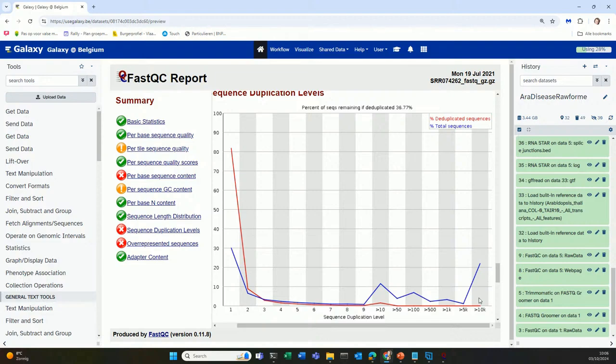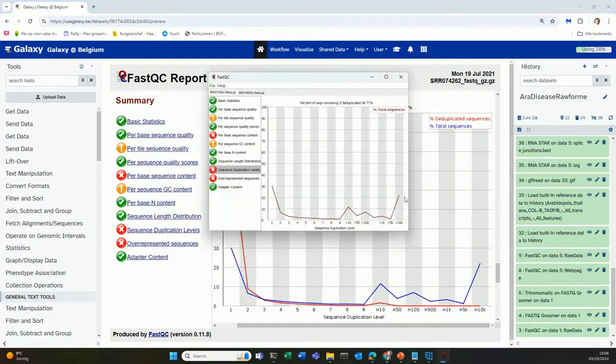And when they are there, they typically pop up here at the utmost right of the plot, because it will be one sequence, the adapter sequence, one sequence that occurs a lot in your FASTQ file. And that's what you see here, or here. So a sequence that occurs very, very often. Your housekeeping genes and your ribosomal RNAs will typically end up here in this region. So these peaks that you see here are probably coming from housekeeping genes. This one is very likely adapter dimers.